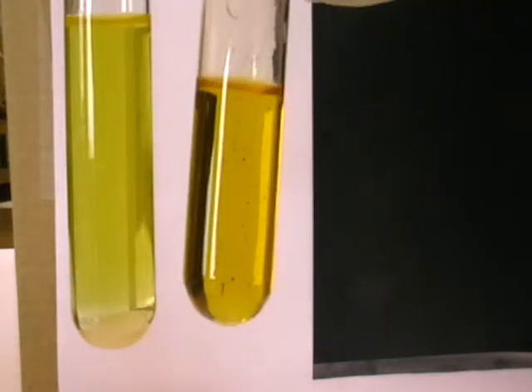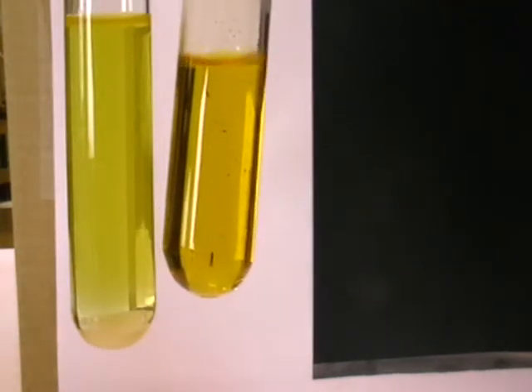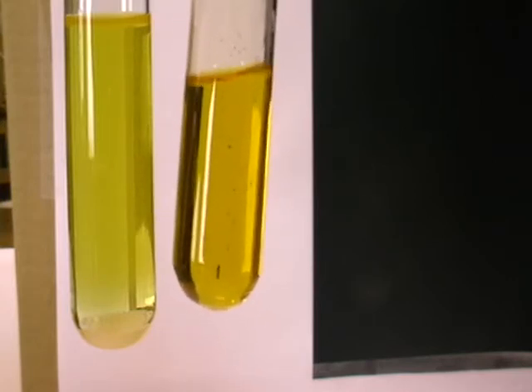So I'm going to add the orange brown solution now. And what we observe is the orange brown colour persists. It is of course lighter in colour since we've diluted it by the solution of sodium chloride.